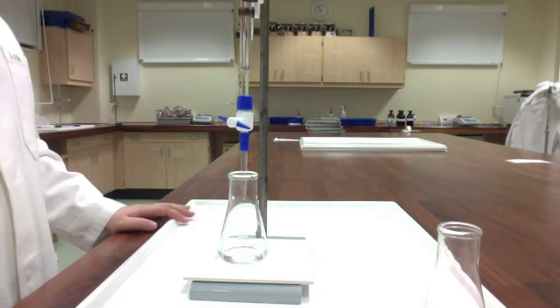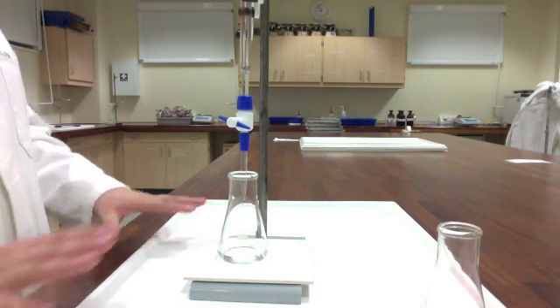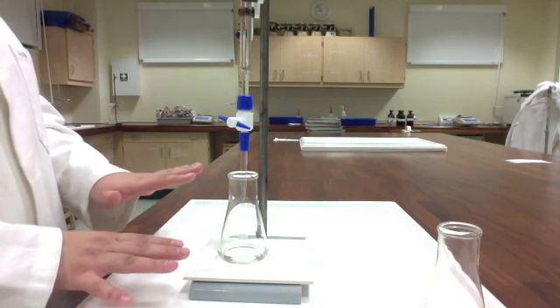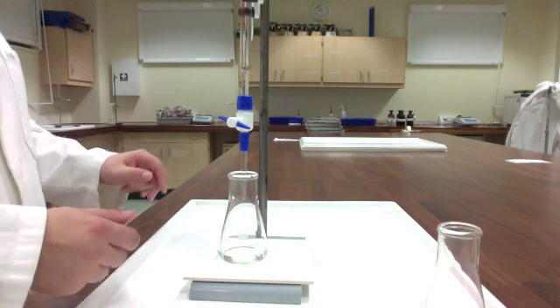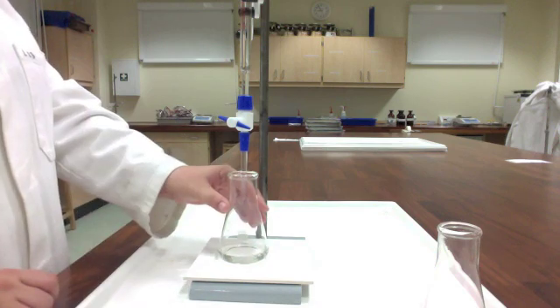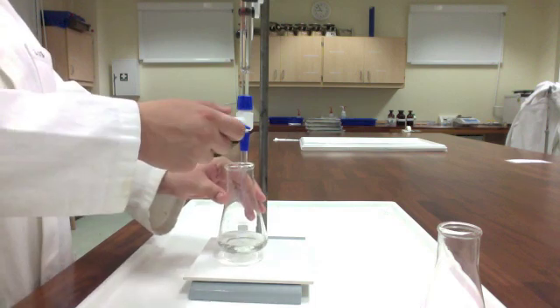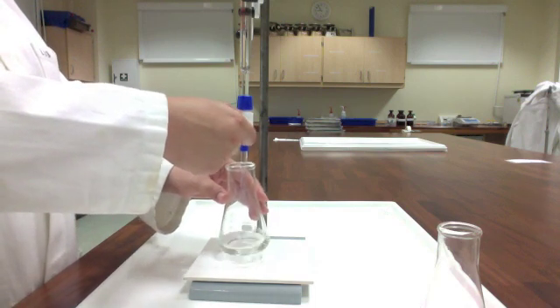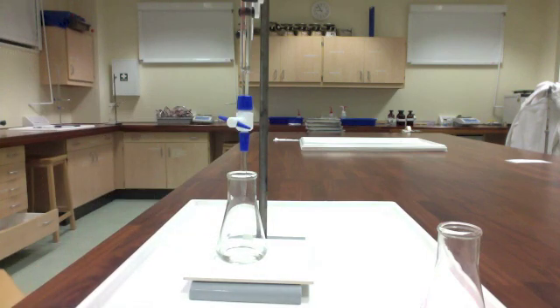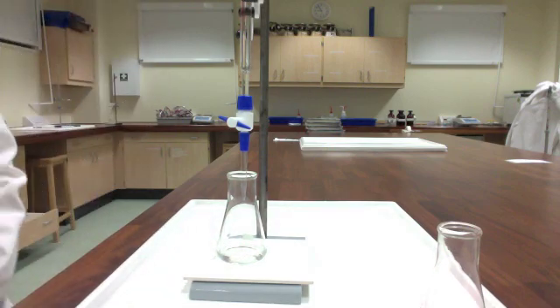So we've got person one prepping the sample. Person two and three, you're going to be doing the titration itself. You both want to be looking at the color of this solution. Again, person three is the swirler. Person two is operating the stopcock here. Now, because I've done approximately 17 million titrations, I'm going to do this on my own.